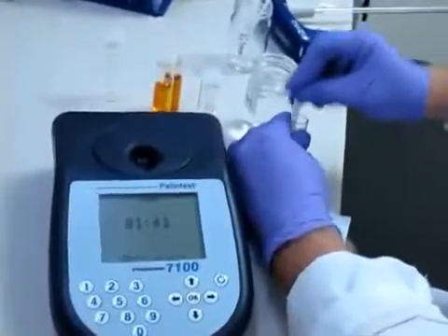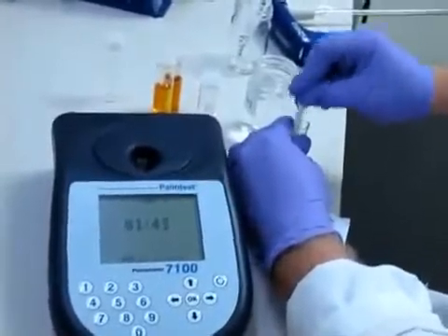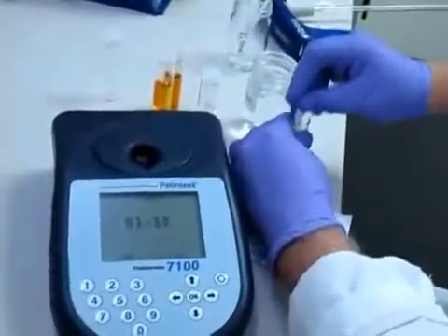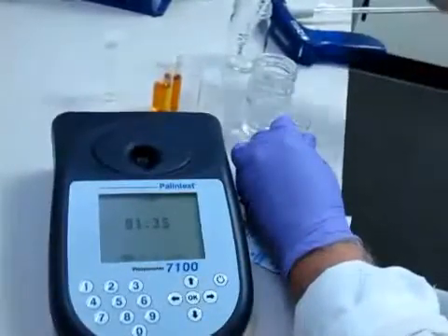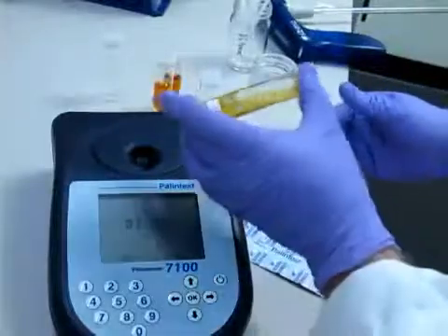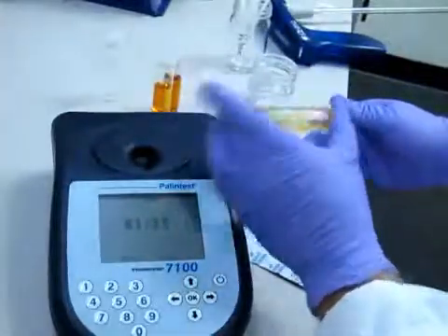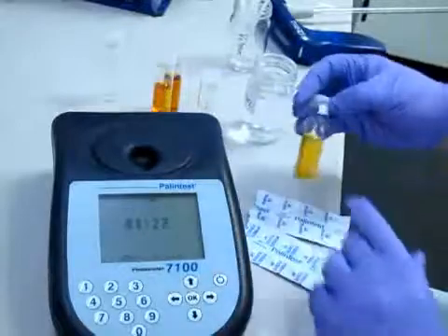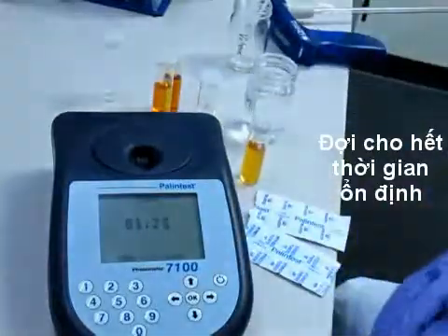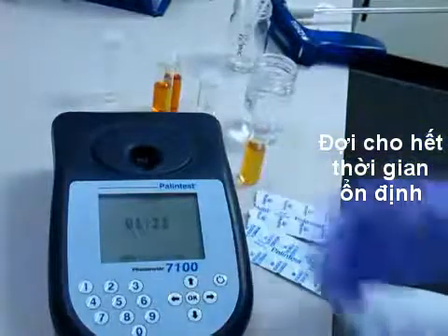Just keep crushing the tablets until they're fully crushed. Then put the lid on and shake back and forth, and just let it sit for the remaining one minute.